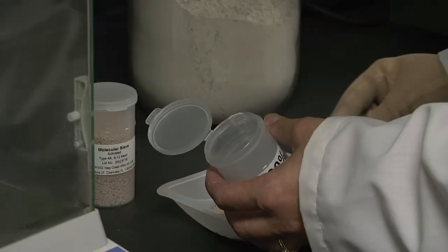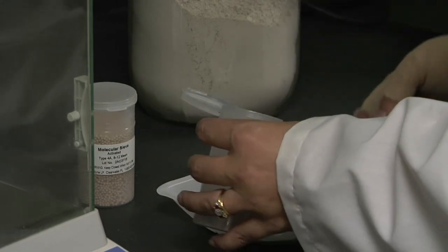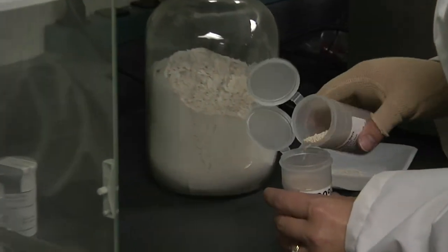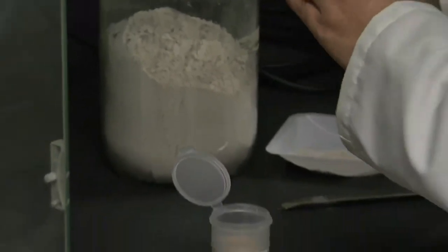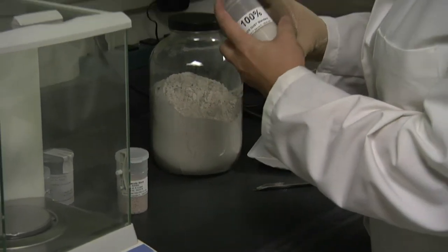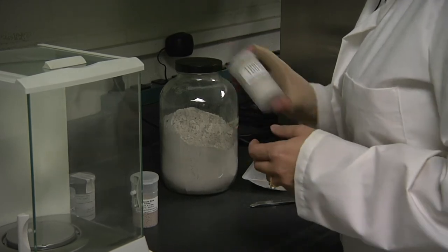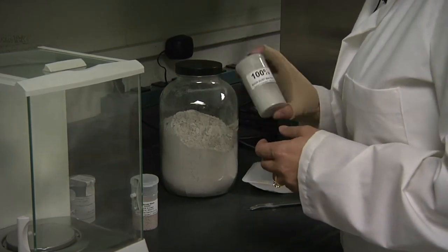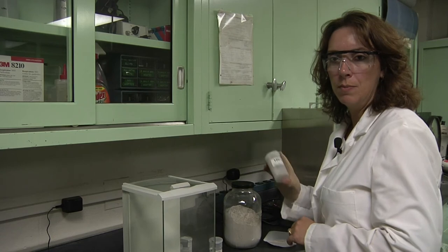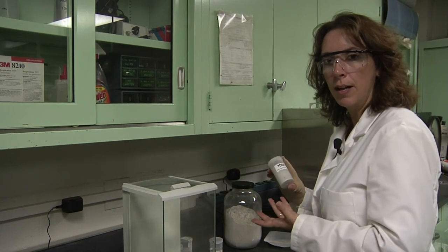When filling the containers, you should probably fill them half full. Add your sieves until the container is approximately three-quarters full. You can shake the sample to mix the sieves with the rock dust to keep the rock dust dry.